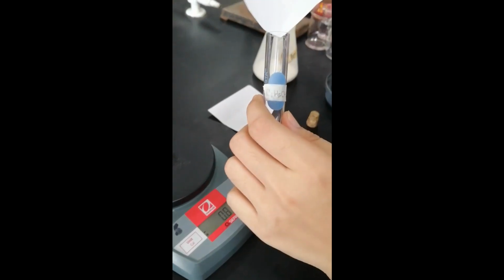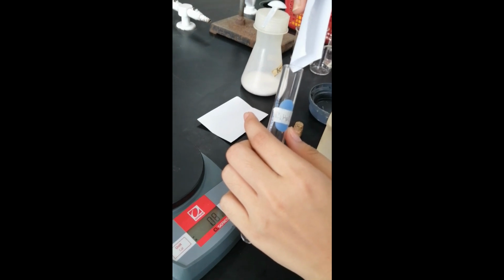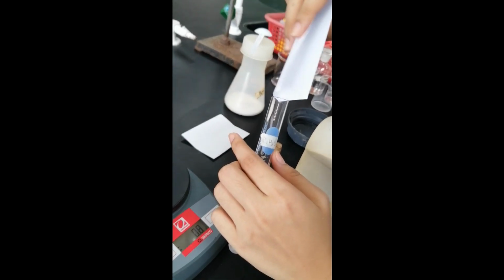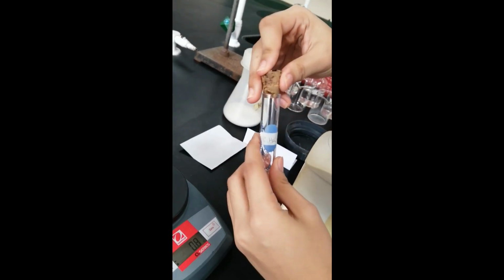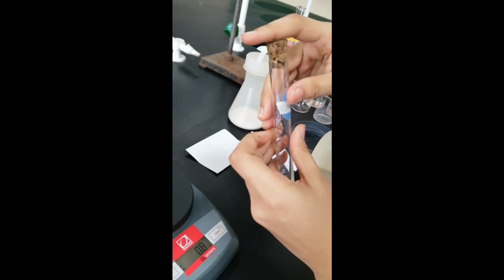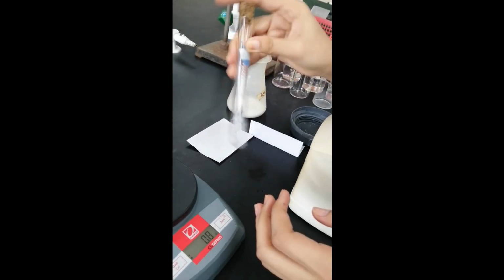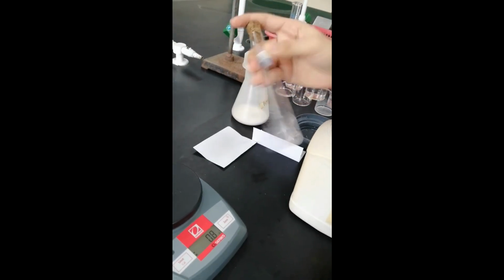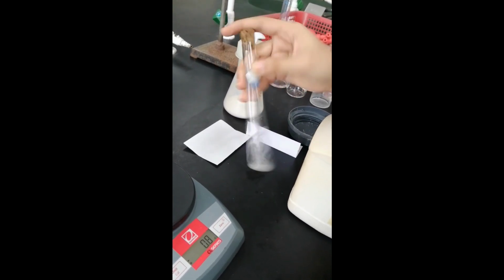First is in ethyl alcohol or ethanol. Gumamit kayo ng paper boat na dapat akma. Shake thoroughly. So, tignan nyo kung madi-dissolve pa yung solute or the NaCl in ethanol.